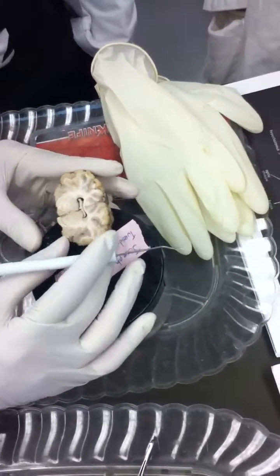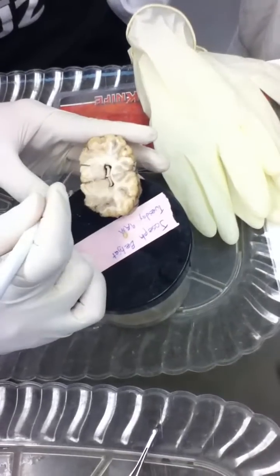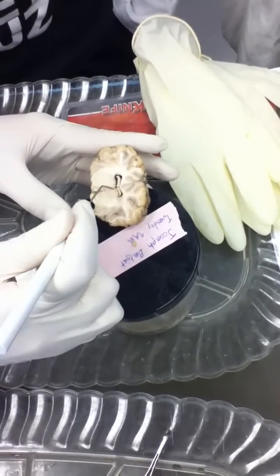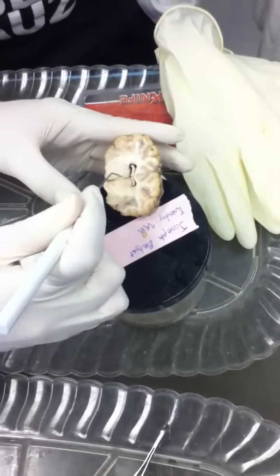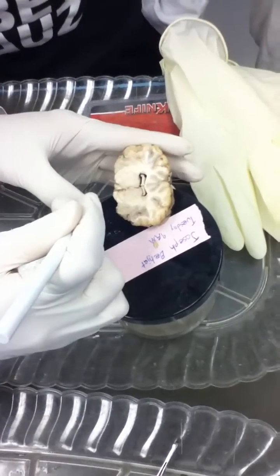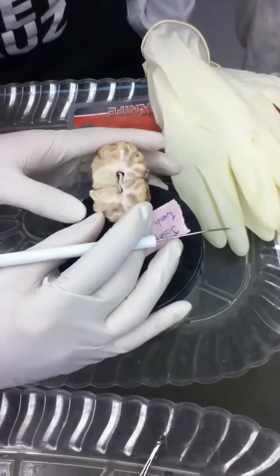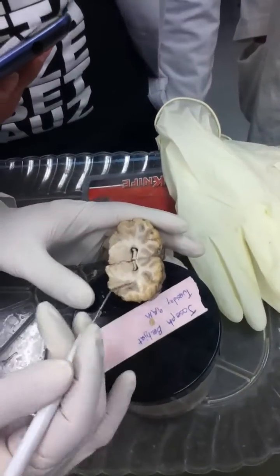So that's all telencephalon. For diencephalon, we have this region here. The thing on top is the thalamus. This region here on top is the thalamus, which makes this bottom region what? Hypothalamus, right.